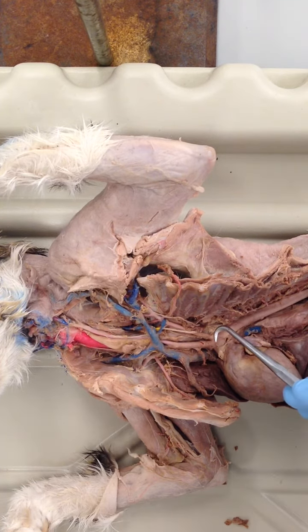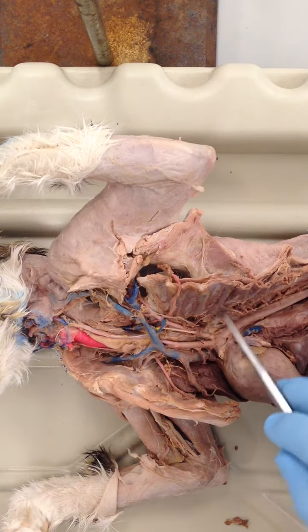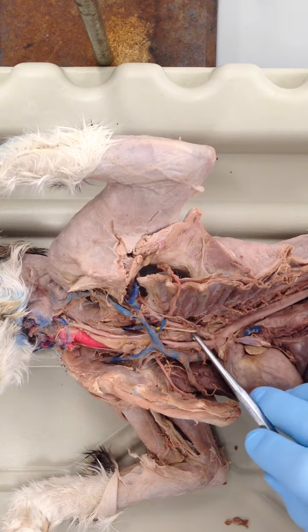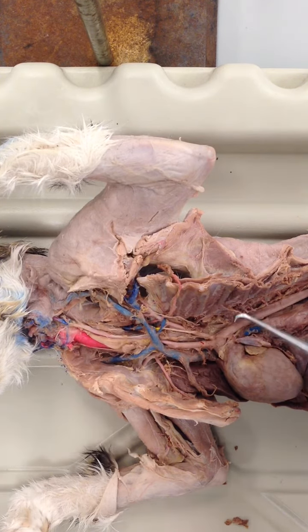Notice also, if you looked at the sheep heart or pig heart videos, they both have the two branches. This first, larger branch is the brachiocephalic artery. The second branch is called the left subclavian artery.